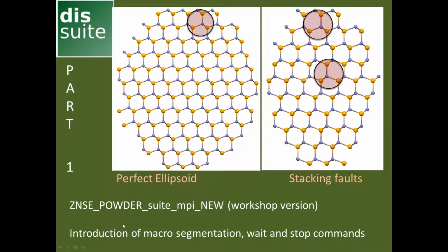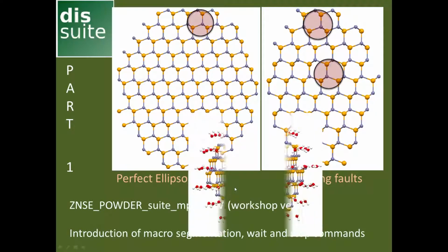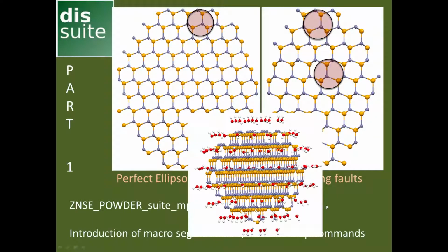So what it generally does, it's creating a zinc selenide nanoparticle, sometimes an ellipsoid or a sphere, and creates stacking faults in this structure, so pretty much local defects. And it's normally used for later on calculating the X-ray powder pattern or the PDF and refining it to data from measurements. What we are going to do today with this macro is calculate a sphere and put some ligands on top of the sphere, just for having used a property for atoms, which I'll mention later.